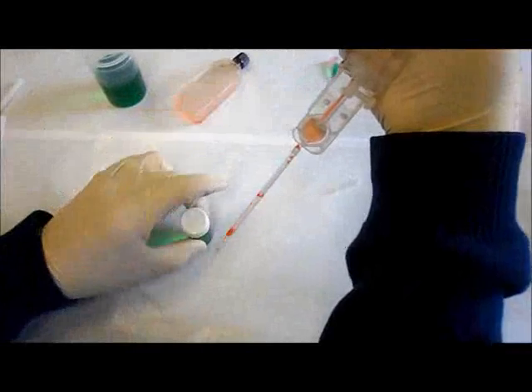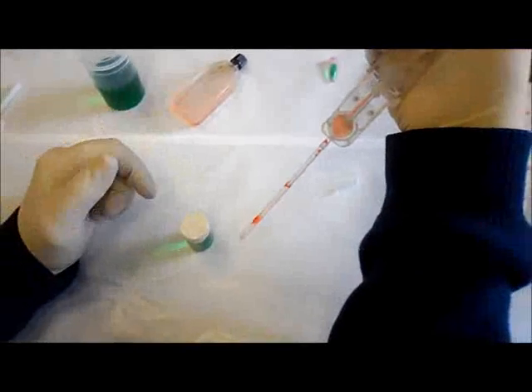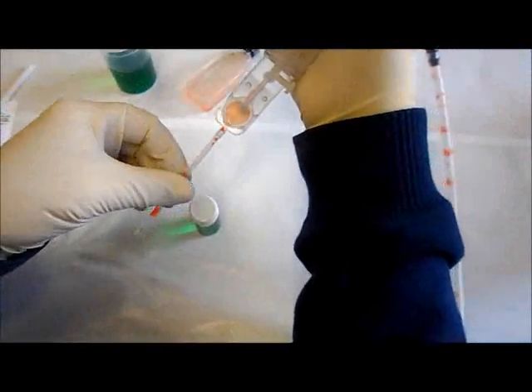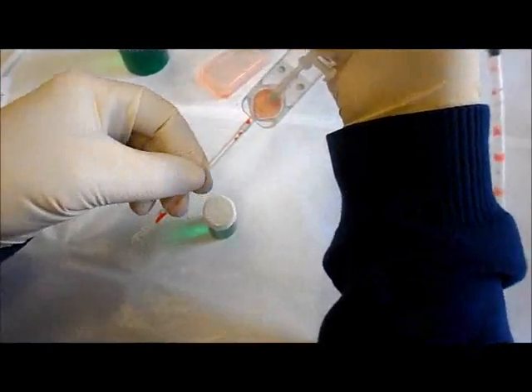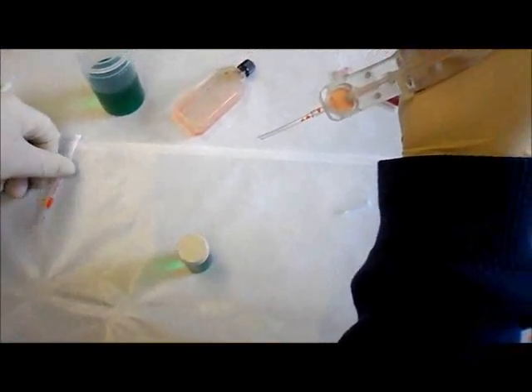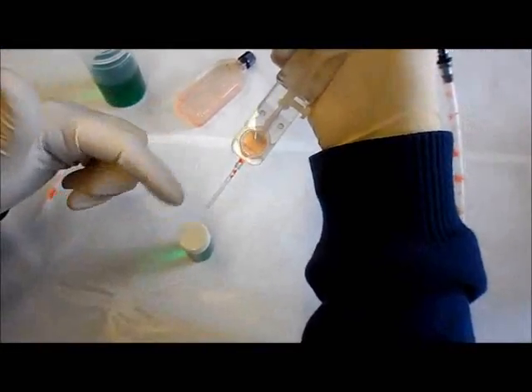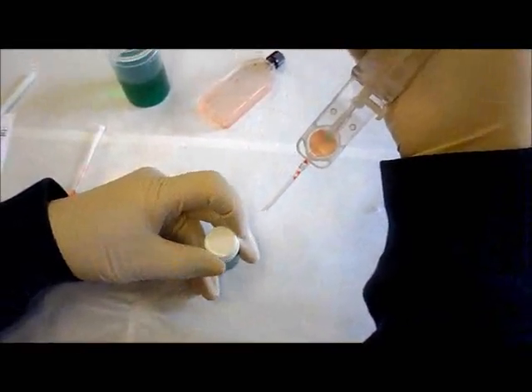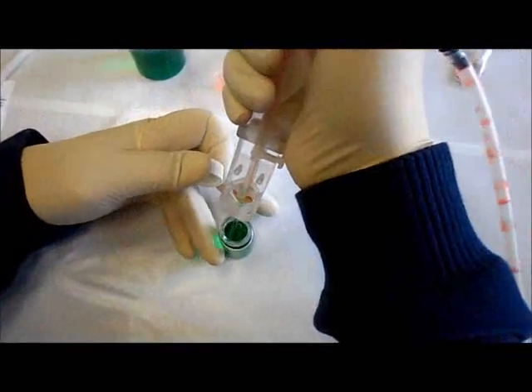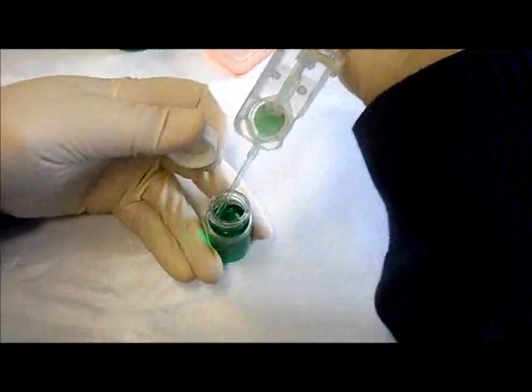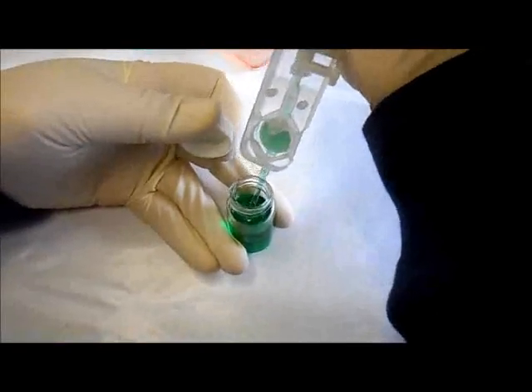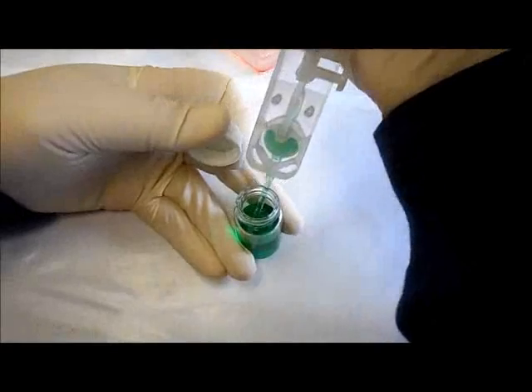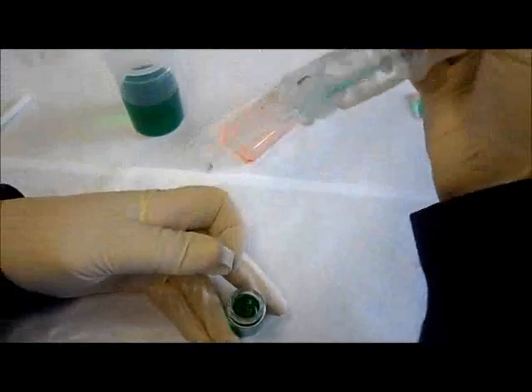Now if we were dealing with some application where you had, say, a variety of reagents that you wanted to deal with and expose sequentially, let's call this a rinse for instance after we've collected and harvested some cells. So I can remove that particular tube and I'm now exposed to, let's say this was a rinse fluid. I can go in, capture the rinse, take air, do this a couple of times even, and get a very thorough rinsing of the cartridge.